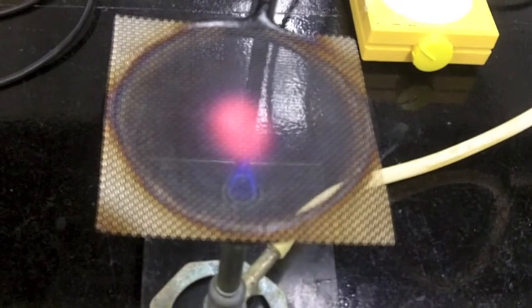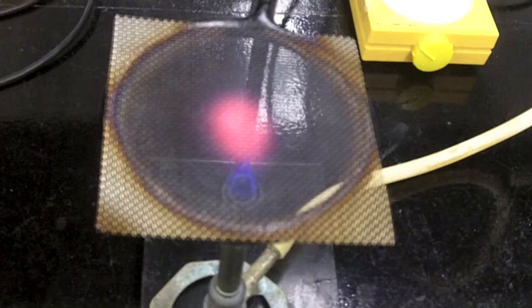So the key is to kind of regulate how big the glowing disk is on your screen. So after you light your Bunsen burner, you should aim for something that's somewhere between a quarter and a half dollar, almost the diameter of the pan, maybe not quite as much.